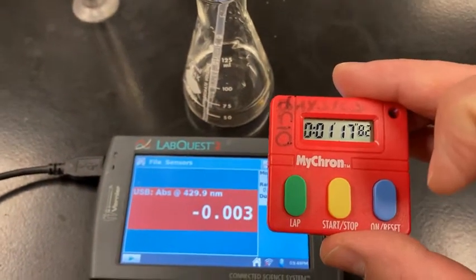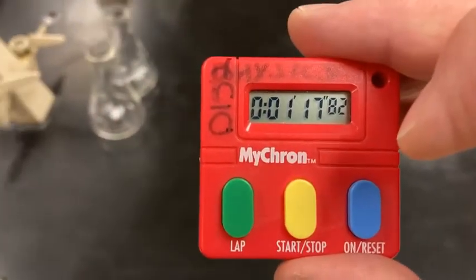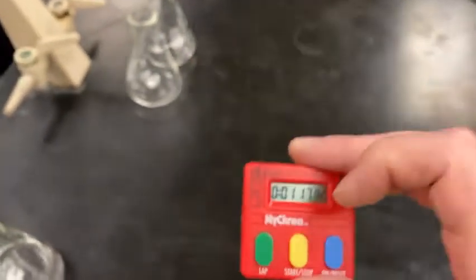Stop it there. Okay. We are at 1 minute 17. Call it 1 minute 18, and I'll let you convert that into seconds.